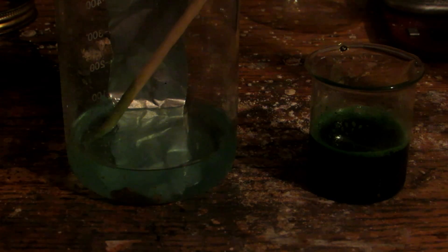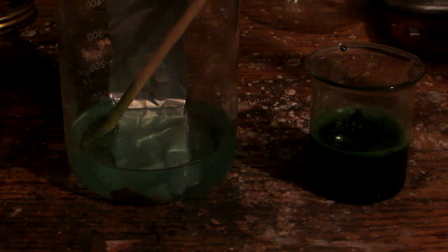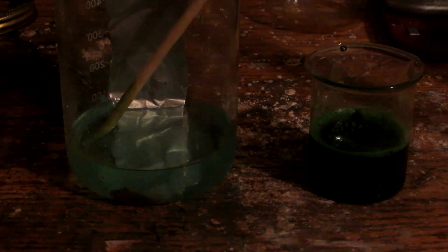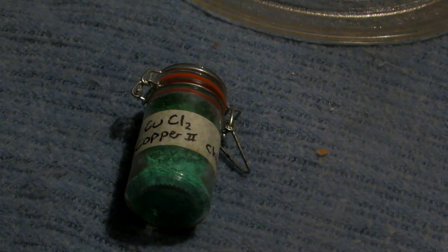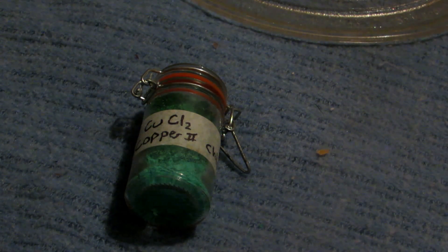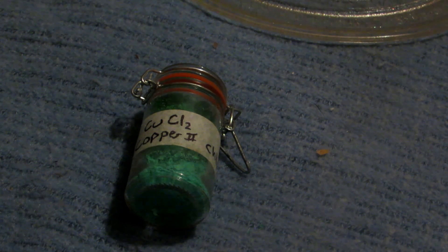I'll meet you back once I've boiled this down in the oven to show the crystals. Make sure not to turn up the heat too high so we don't decompose it to the anhydrous form — we really want the hydrated form for the chemical garden reaction. Here's our final copper chloride. I mixed it in with the rest of the copper chloride I have, and as you can see there are some rather nice large chunks in there. We're going to be using this for the chemical garden experiment and possibly other experiments in the future, as copper chloride is a fairly useful chemical. It can also apparently be used as an etchant for printed circuit boards. Anyway, that's basically how to make copper chloride, and in a future video we'll be using this in the chemical garden, which will be very cool!